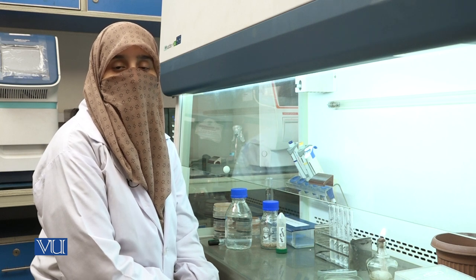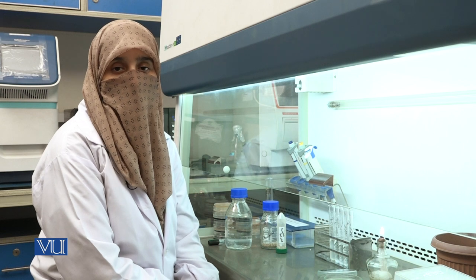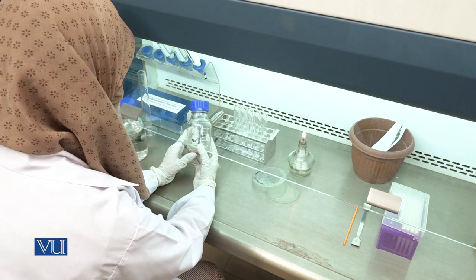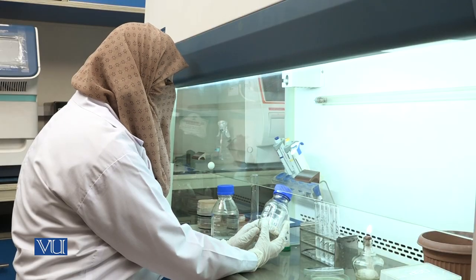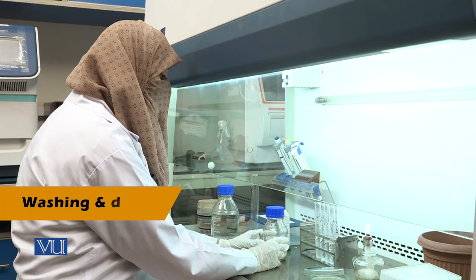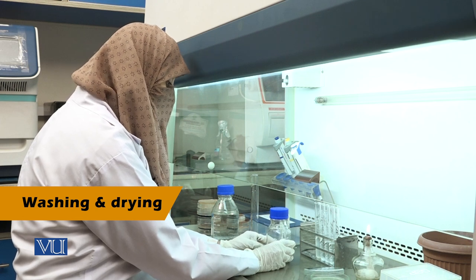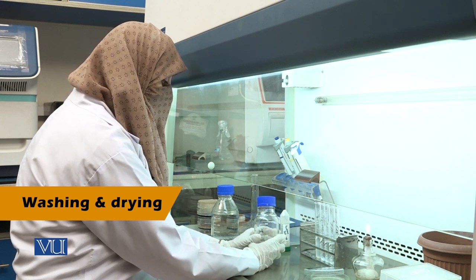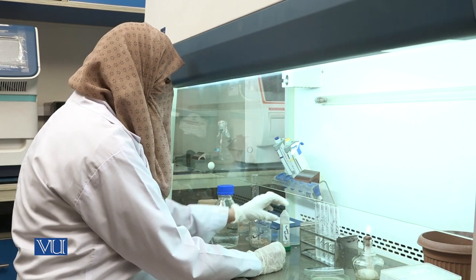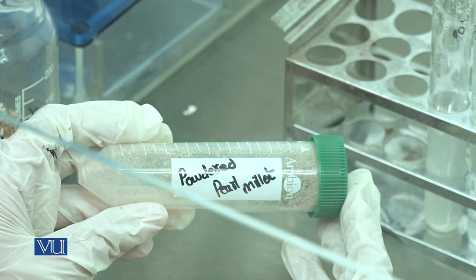For the preparation of pearl millet, the following procedure is used. Purchase pearl millet from market in a sterile bottle. The grains are washed with the help of distilled water and then dried under sun. After drying, prepare powdered pearl millet with the help of a sterile blender.